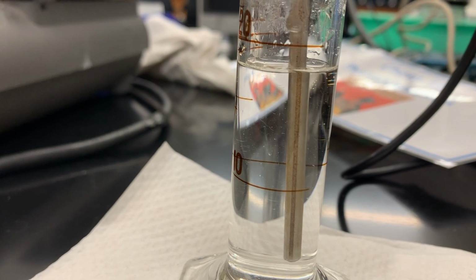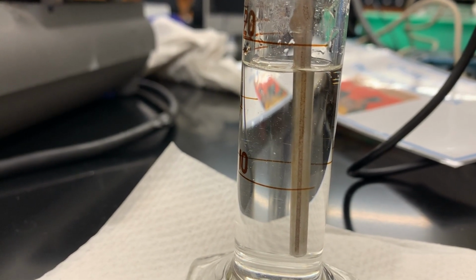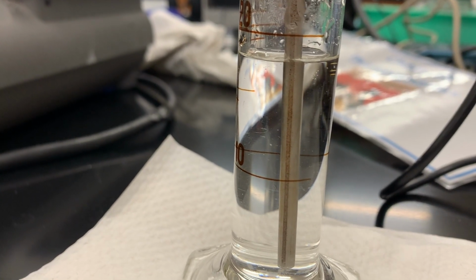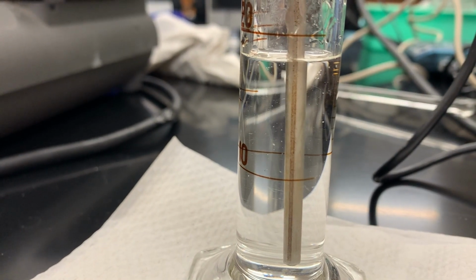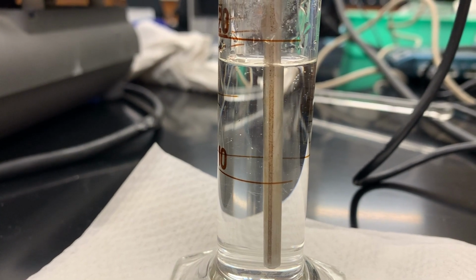I think now you can see those crystals floating around in there, so that's what I was looking for. Okay, so as soon as those crystals started floating around, you could kind of see it against the black background. That was what I was looking for, the crystallization temperature, just when they start to form. So you can see them floating around.